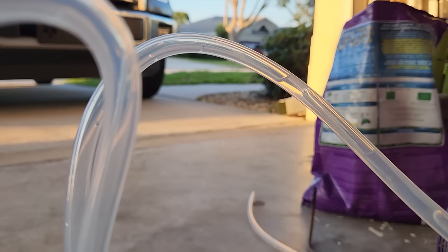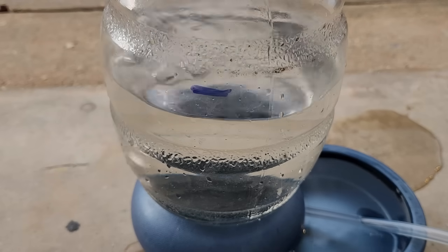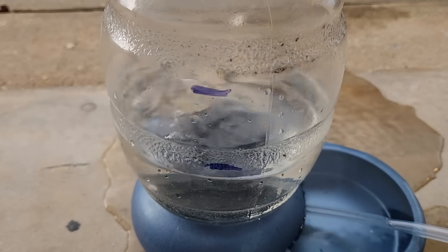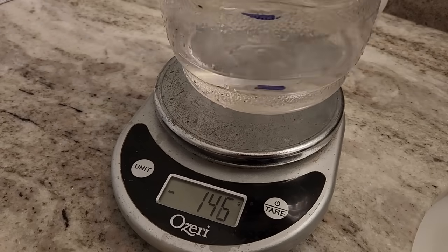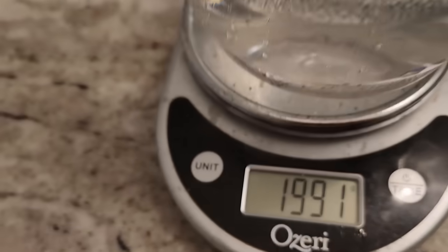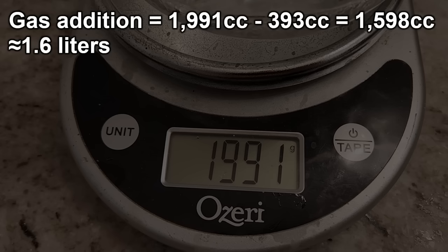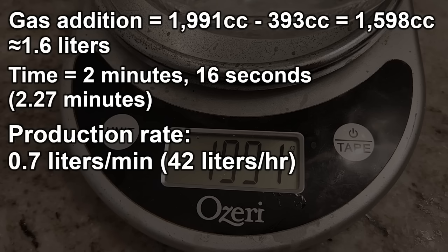Let's try to get some idea of how much ethylene gas we're actually producing. To do this, I hooked up the output of the generator to a tube and bubbled it up into an inverted bottle, marking the water levels at the beginning and end while running a timer. As gas bubbles up into the bottle, it displaces the water, causing it to be pushed down and out of the bowl. After a little over two minutes, the water is emptied out. The initial air volume in the bottle was 393 cc and the final volume was 1,991 cc. Subtracting the two, I added 1,598 cc or about 1.6 liters of ethylene gas. I bubbled the gas in for 2 minutes and 16 seconds, giving an average production rate of about 0.7 liters per minute or 42 liters per hour.